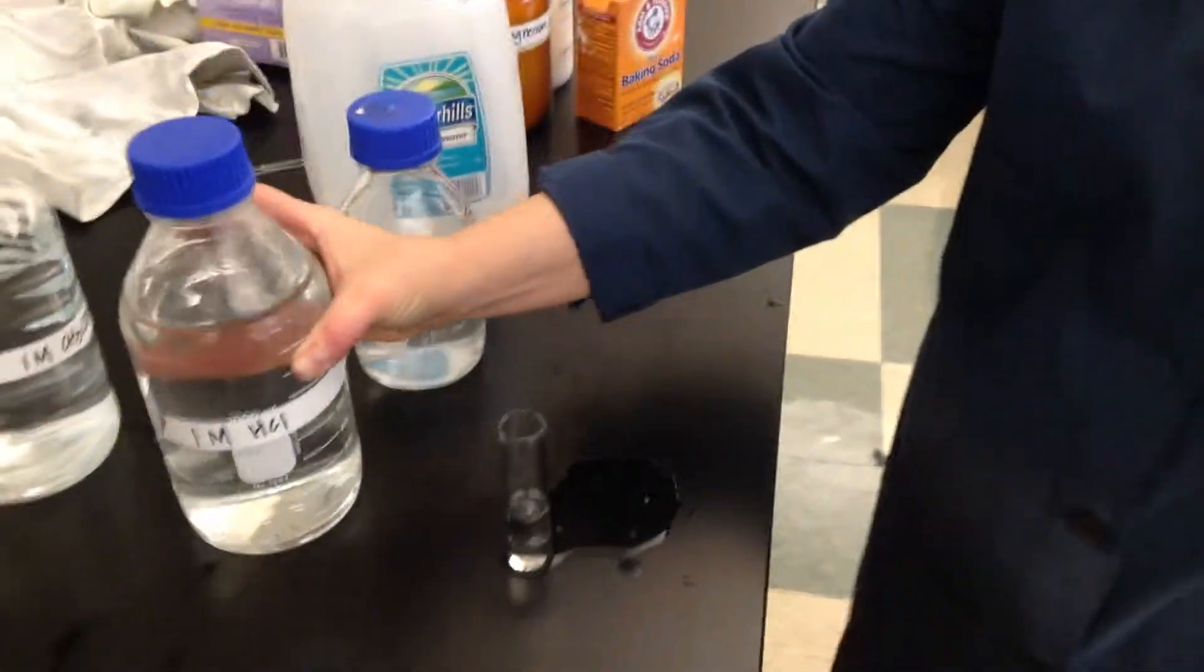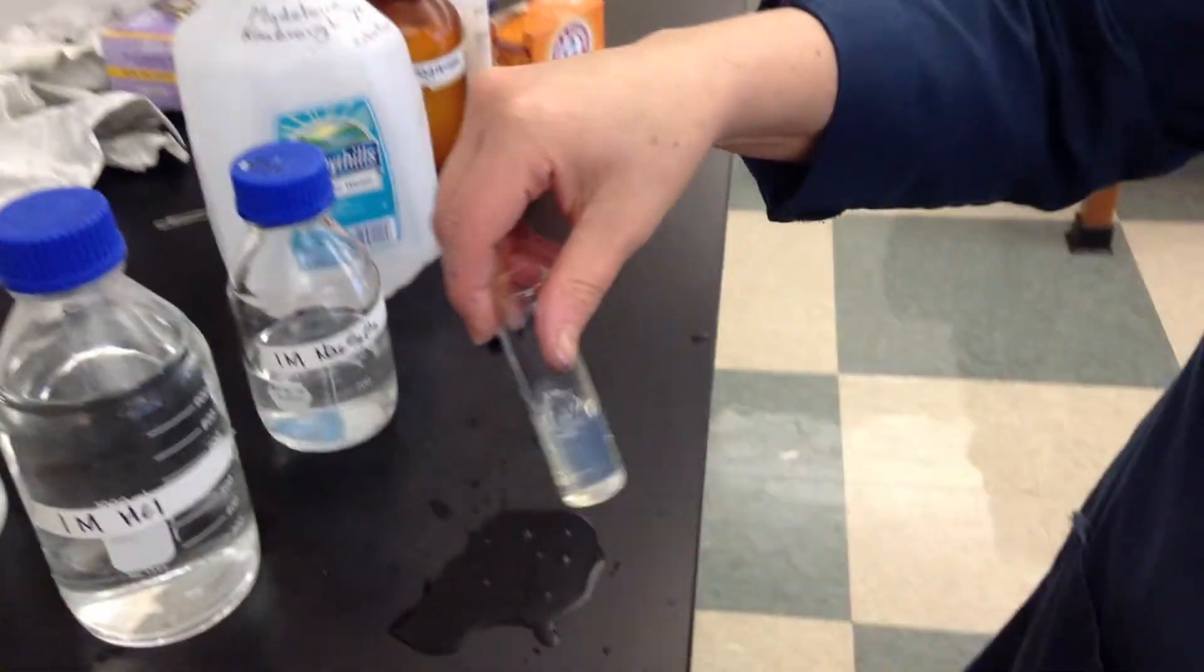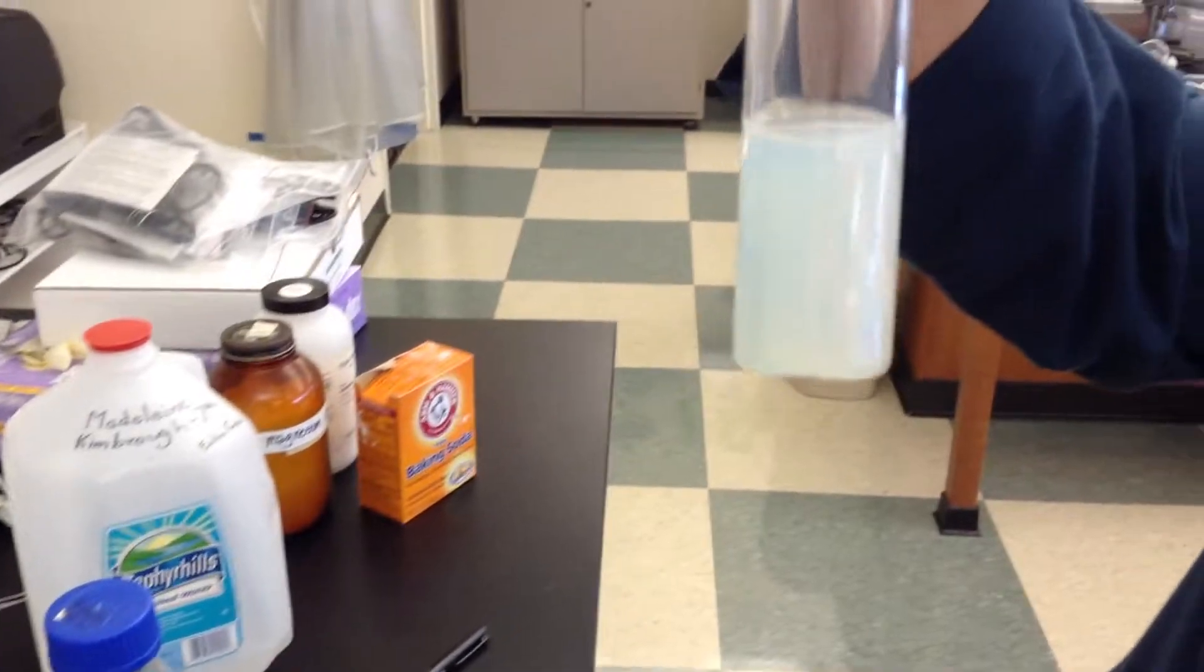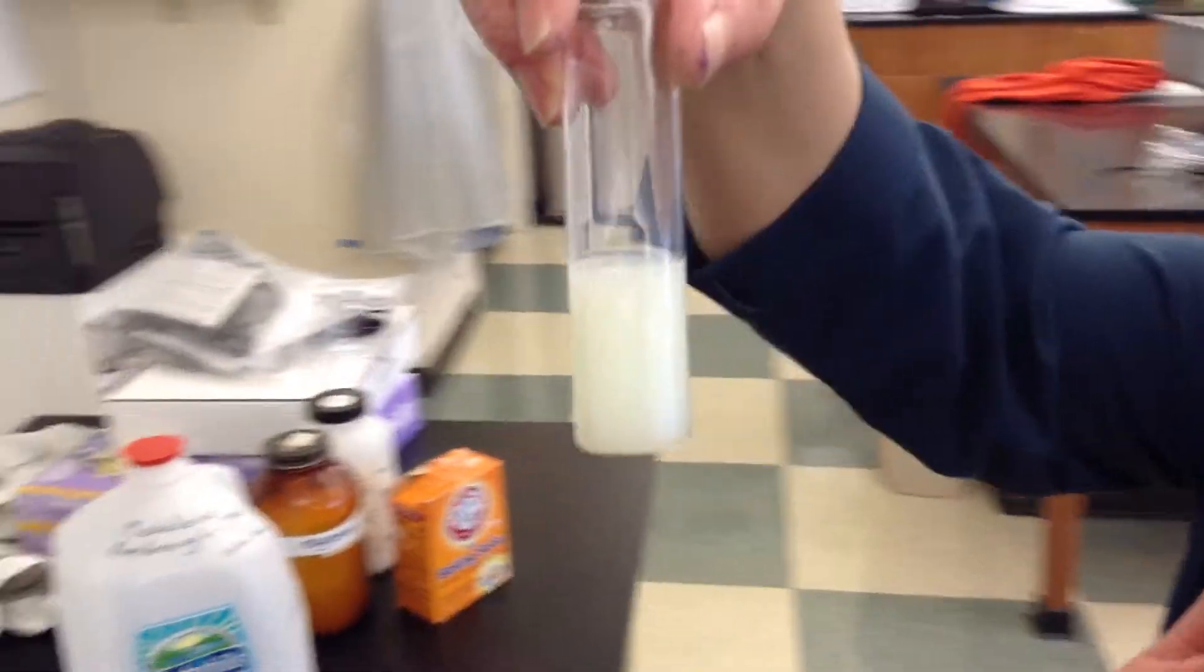And over time, you stir and stir. Do you see it's getting cloudier and cloudier? At some point that X will not be visible.